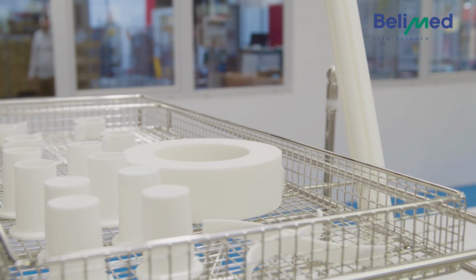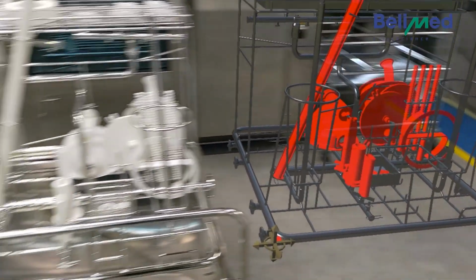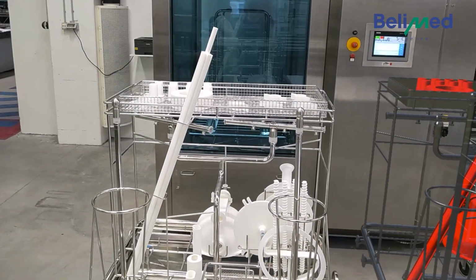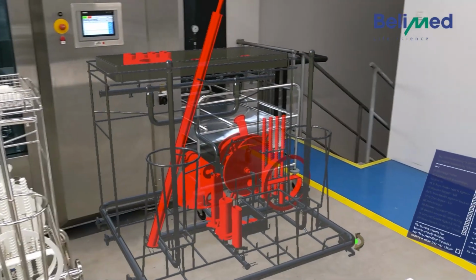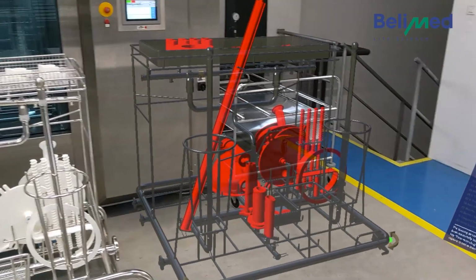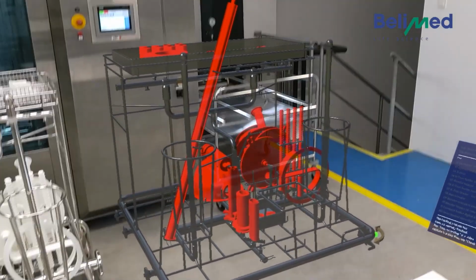The loading process has been successfully finished. A final check has been performed. The real rack looks exactly the same with the washed goods as the virtual model. So all washed goods are positioned correctly. The program of the virtual rack can now be finished and closed.